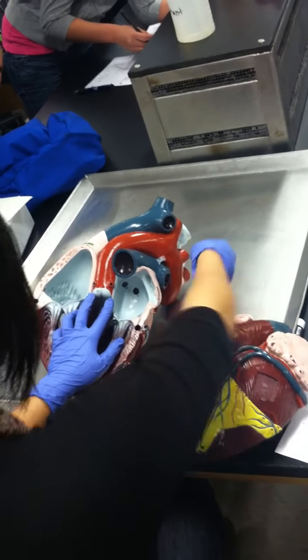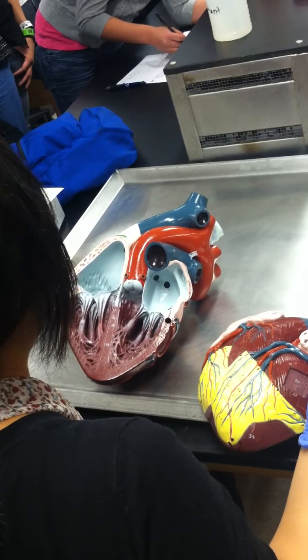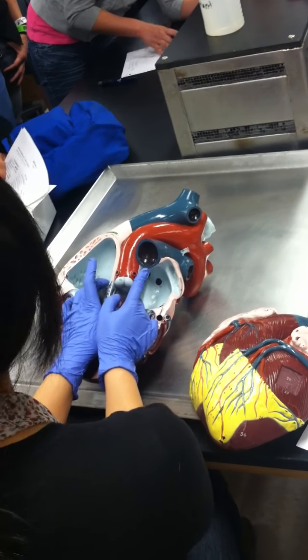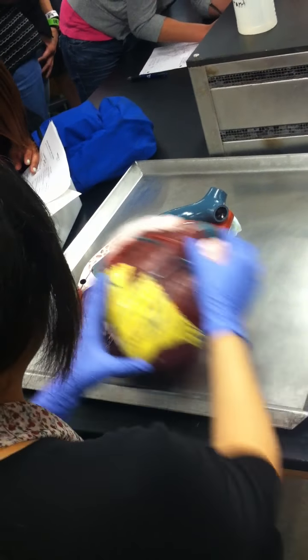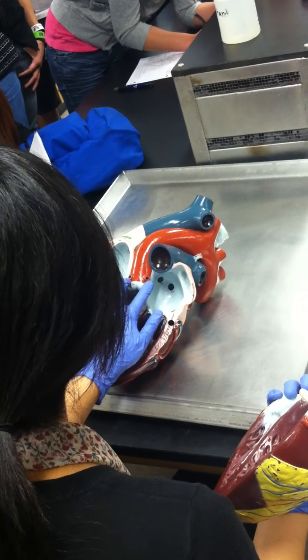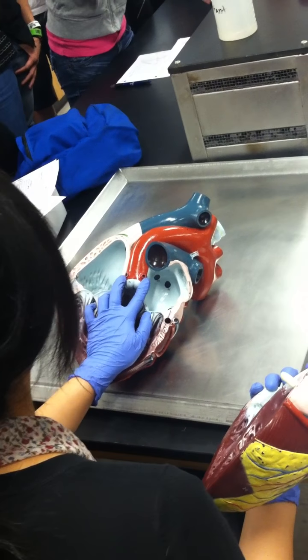So if you look at your aorta, remember the big blood vessels carrying blood away from the heart? You have vessels, the first branch that comes out of it, and they're actually located inside the heart. So before they exit the heart, you can't see it out here, but you can see it here. So these two branches coming off, they are your coronary arteries.